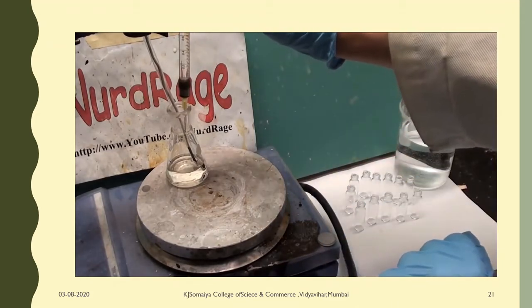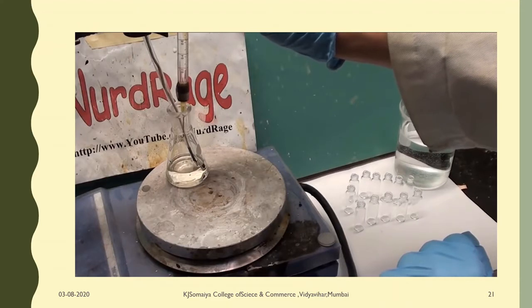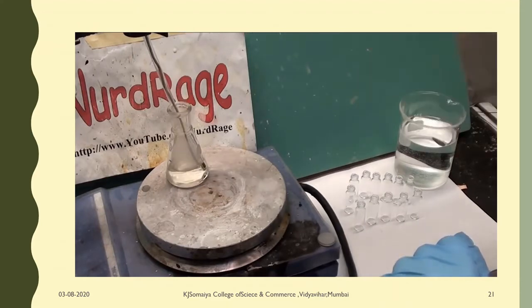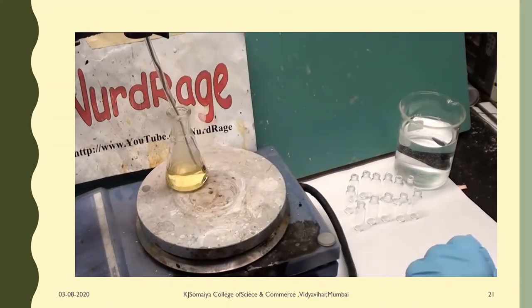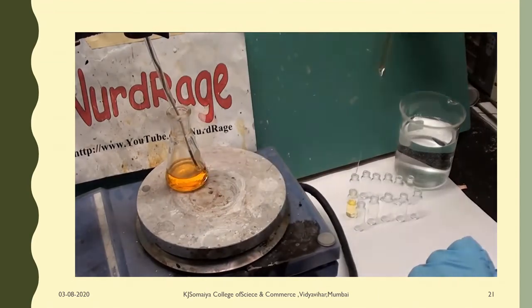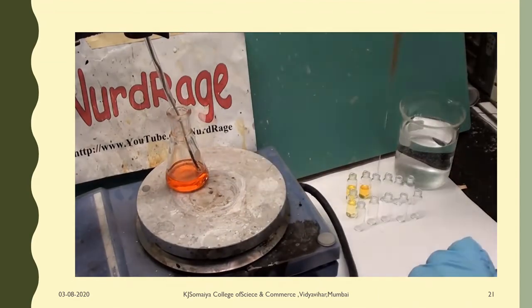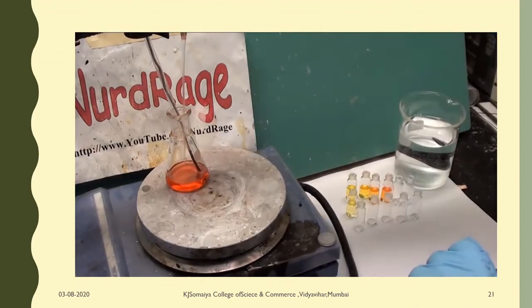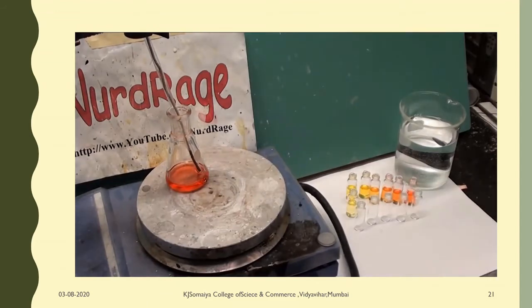Once the cadmium solution reaches 225 celsius, inject the selenium solution and give it a quick shake. Now immediately start withdrawing small samples of the solution, about half a milliliter to a full milliliter and put them into the vials. For the first several samples try to do this one after another as fast as possible. Then withdraw only when you see the color significantly change.